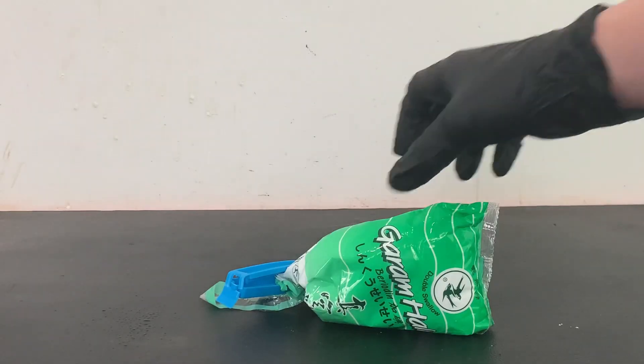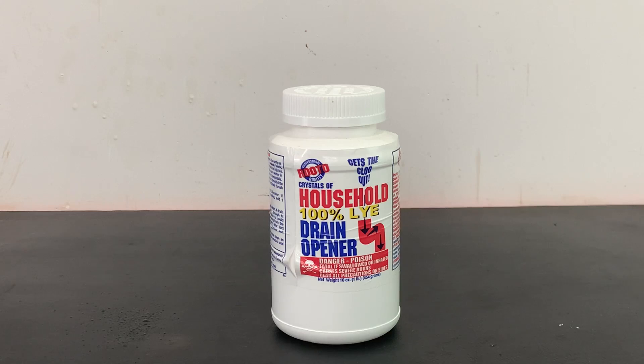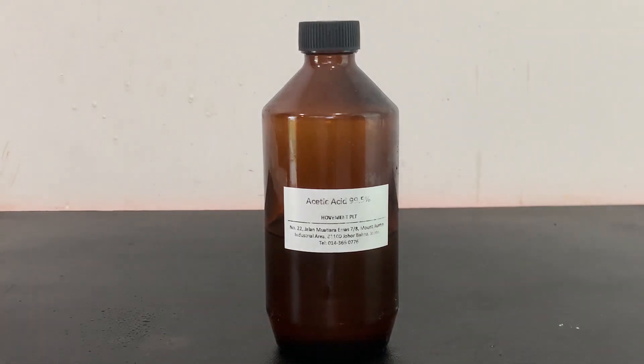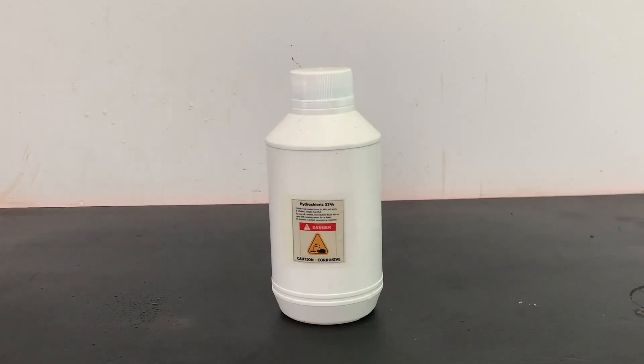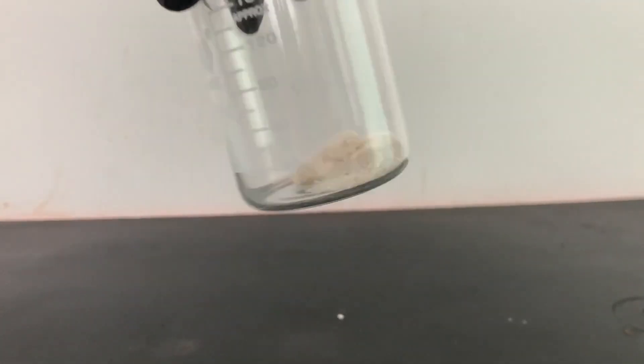I also used 10 grams of sodium chloride, 3 grams of sodium hydroxide, 5 milliliters of glacial acetic acid, and 5 milliliters of concentrated hydrochloric acid.